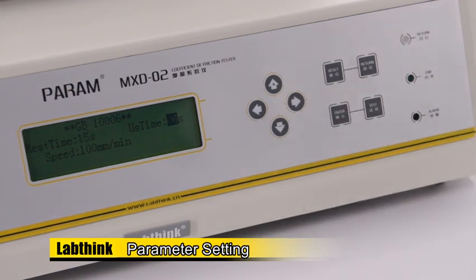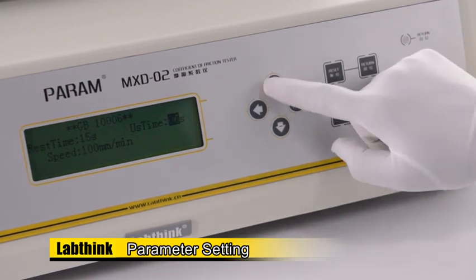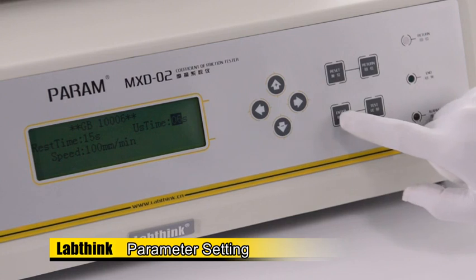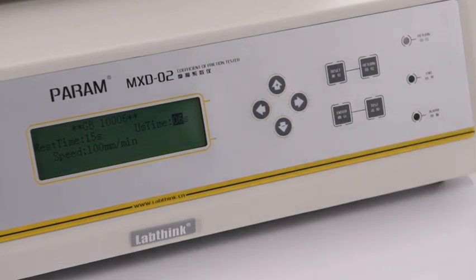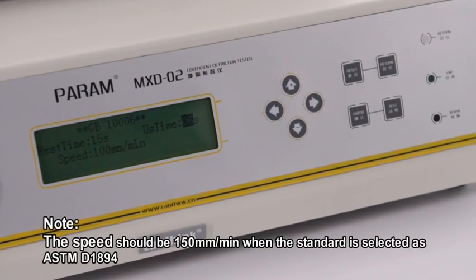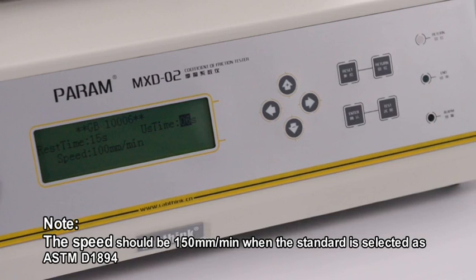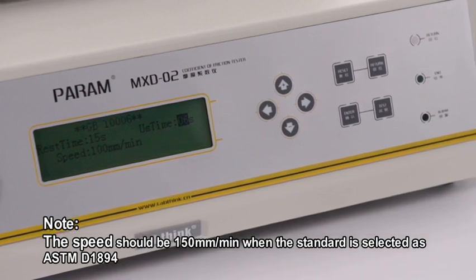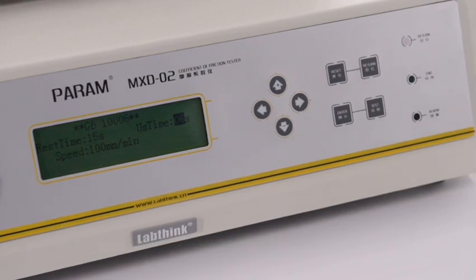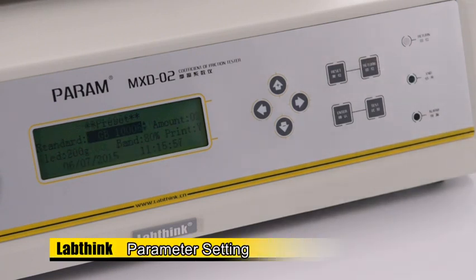The data collected in the first 6 seconds will be used to calculate the static coefficient of friction, and the data collected in the remaining time after 6 seconds will be used to calculate the dynamic coefficient of friction. The speed cannot be changed, which is 100 mm per minute, required by GB 10006 or ISO 8295. Press Return to return to the preset interface. Set amount as required and press Enter to save the setting.